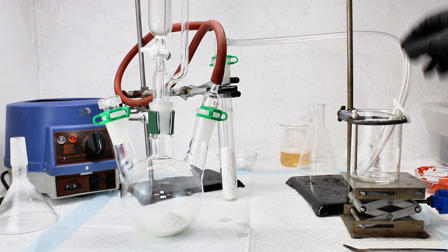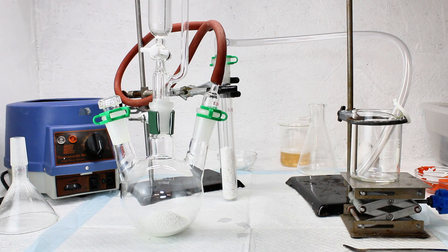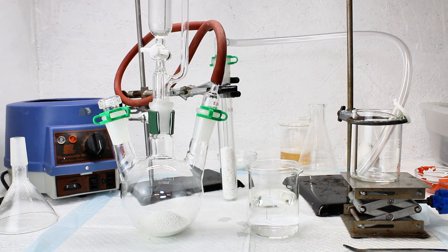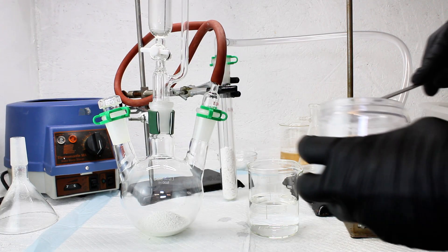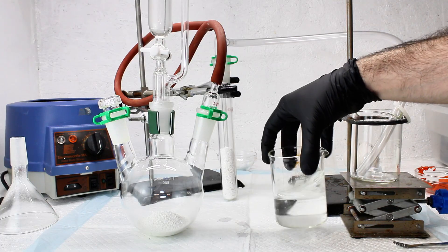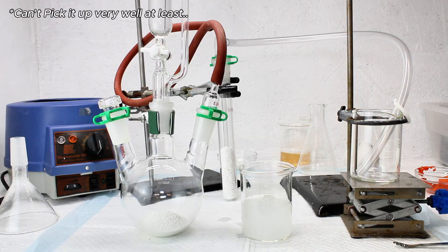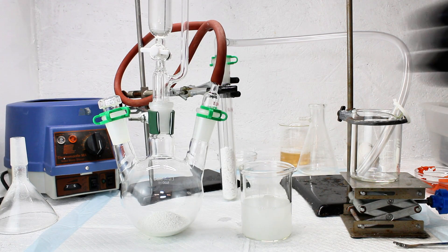In order to demonstrate this, you need to make a lot of singlet oxygen confined to a small space, and this can be achieved by reacting concentrated hydrogen peroxide with hypochlorite, as you've been seeing me do here. This light is actually so dim that my DSLR can't pick it up, and my phone camera can only pick it up if it uses such a high ISO that the resulting video is a grainy mess.